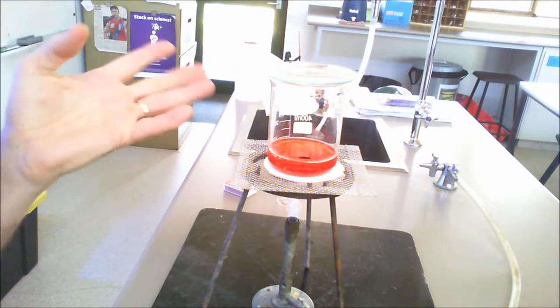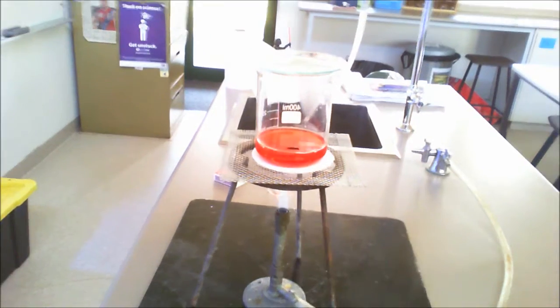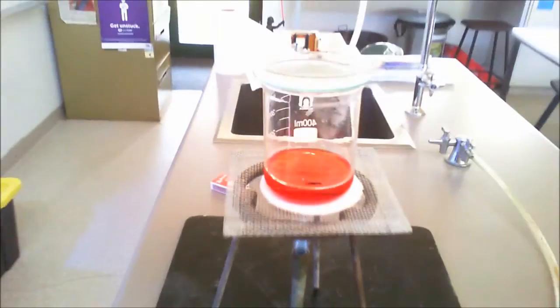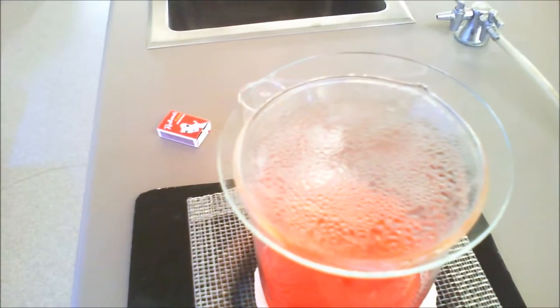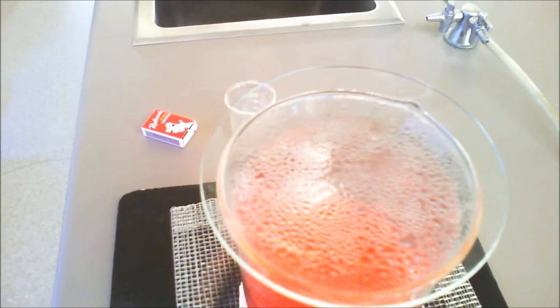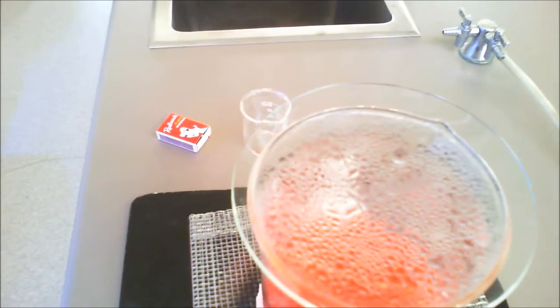Now you might have noticed, or that's a little bit hard on the screen, that straight away it started to fog up. Then what you'll also be able to notice, if I just bring in the camera on top there, is that liquid is starting to be formed. So when we boil the water at 100 degrees, it rises up, it hits the watch glass. That's less than 100 degrees, so it basically reforms into water again.